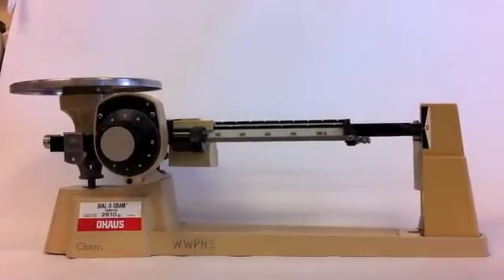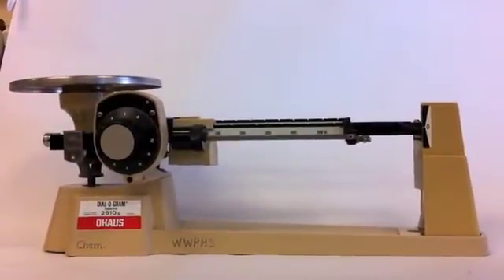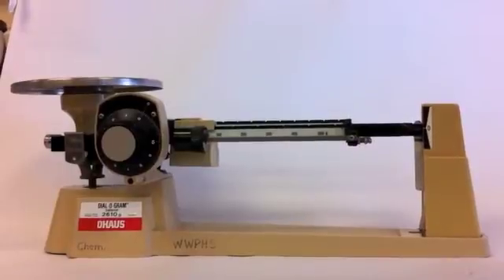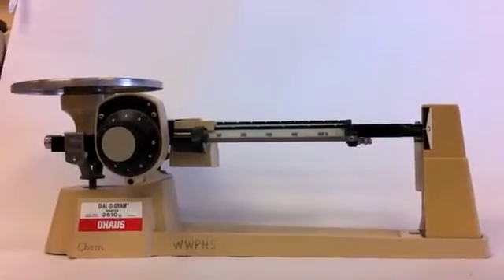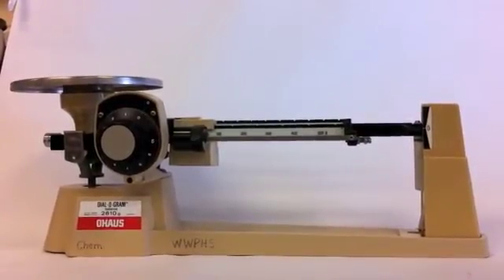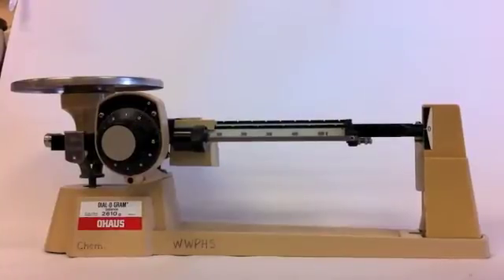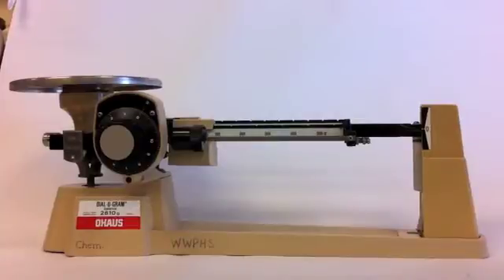This is the dial-o-gram balance that you'll be using in honors chemistry for most of your weighing needs. When you're ready to use the balance, be sure to pull it slightly away from the wall but keep it on the ledge. You want it to be on a flat surface, and we don't want to be moving them around the classroom.